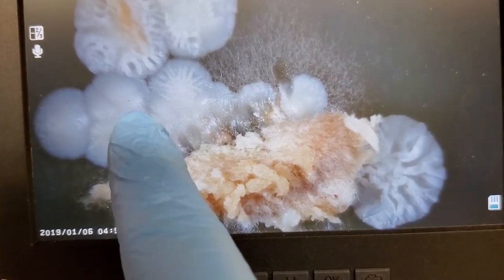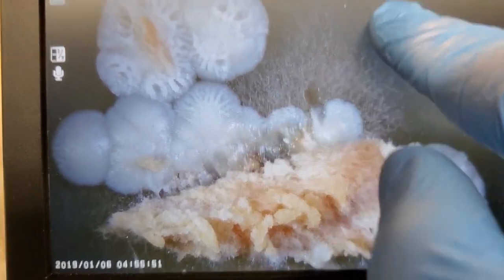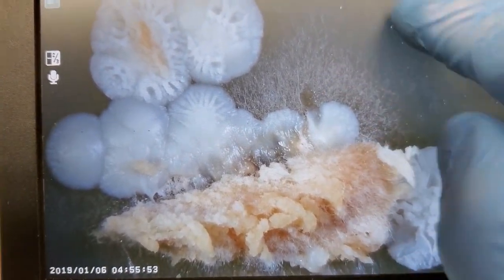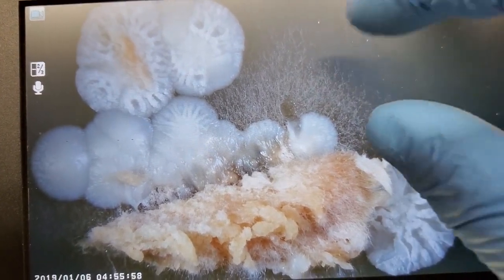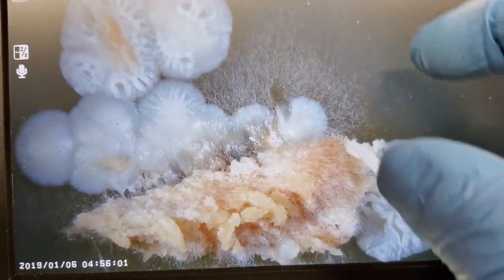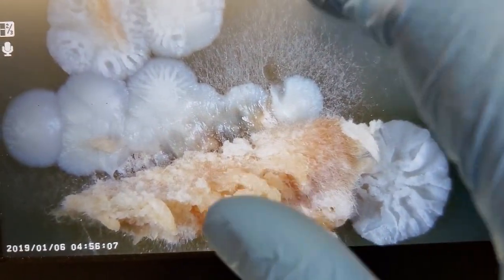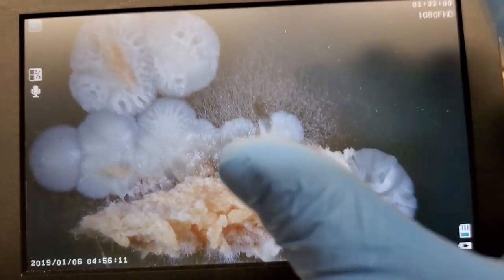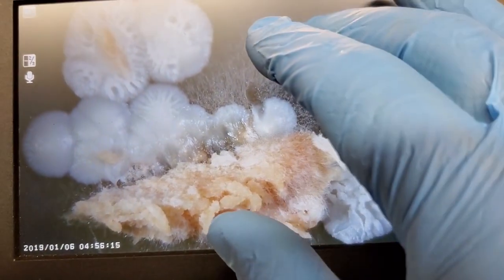That sucks, but at the same time, that's actually not the end of the world, because that means we have a really nice large sample that we could take a nice big chunk of the mushroom mycelium from, a spot that would be over here all by itself, and then we could transfer that onto another petri dish, and usually that should give you a pretty good clean sample as long as you are careful about your air quality and your sterility procedures and all that stuff.